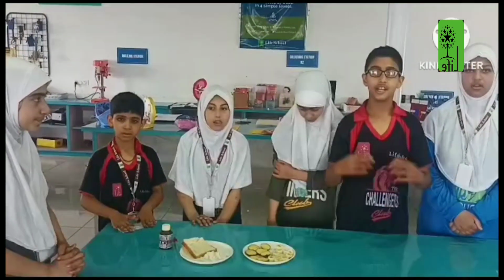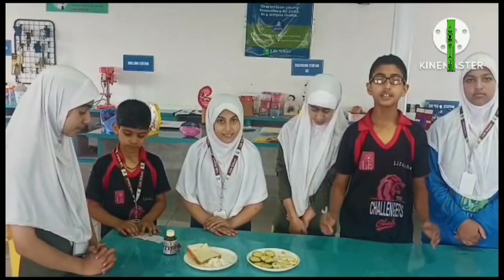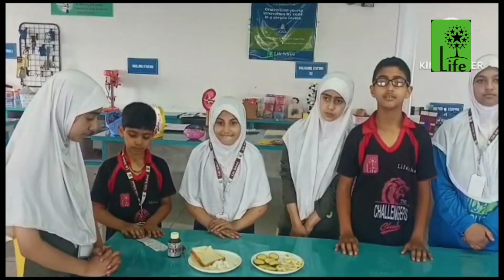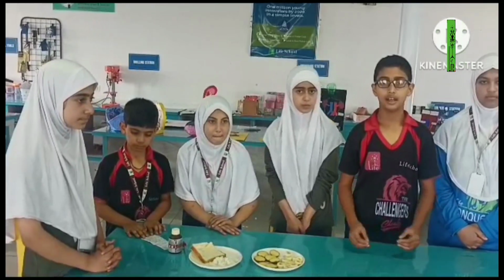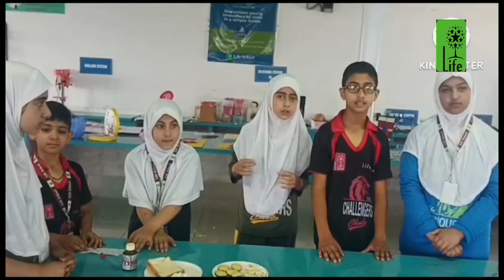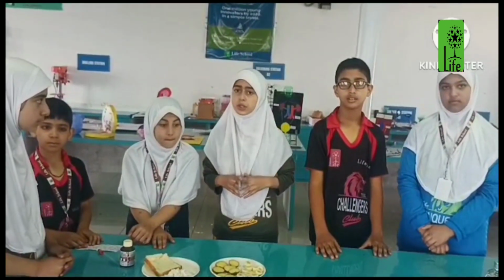Today we are here in the lab for the test of starch. So, what is a starch? Starch is a carbohydrate naturally found in many grains and vegetables such as wheat, rice, potato and banana. Starch is the main source of energy for the human body, and most of us consume food containing starch on a daily basis.